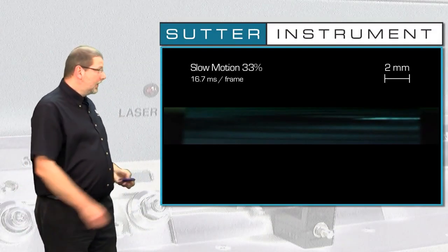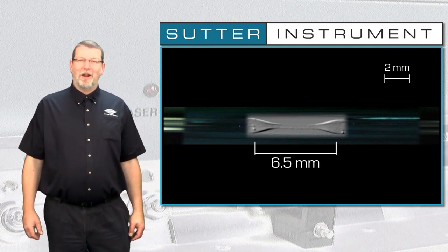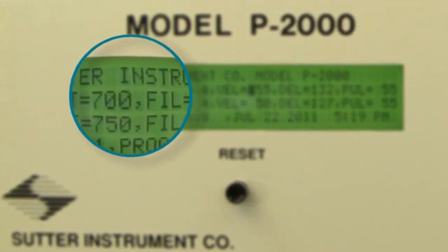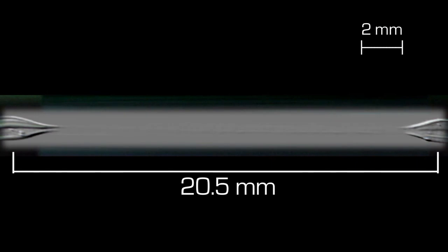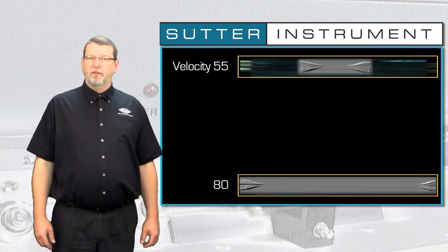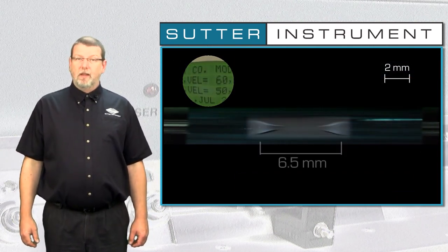So let's rewind and take a look at the hourglass the first heating cycle has produced. If what I just told you is true, a higher velocity should give us a longer hourglass than those 6.5 millimeters, correct? To test my hypothesis, we're changing the velocity on line 1 from 55 to 80. Here's the first heating cycle at the same scale in parallel view, more than a whopping 20 millimeters. We'll put that down here for comparison and run a few more pulls with a velocity in between those two extremes.